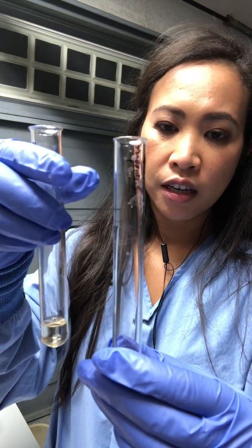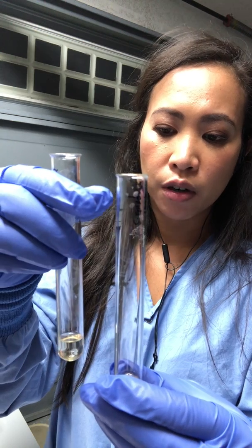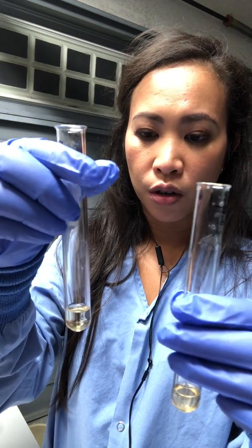It still tested positive because it shows the reddish tint on both of the test tubes. Now, for the Voges-Proskauer test, this is very similar to the Methyl Red testing. However, instead of using the Methyl Red agent that's stored in here now, we were asked to go ahead and add Reagent B. First, it was Reagent A. After that, we were asked to add the Reagent B, and the medium we let stand for 30 minutes and observe the color.